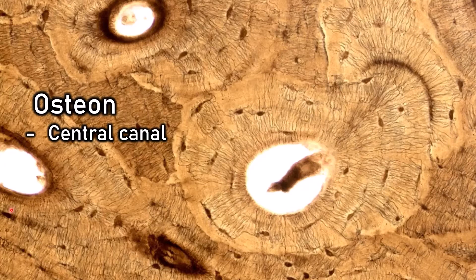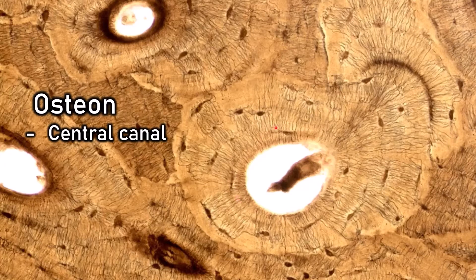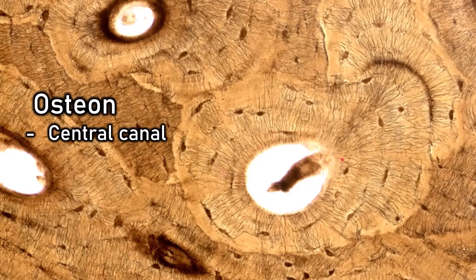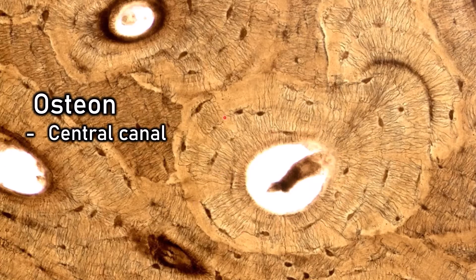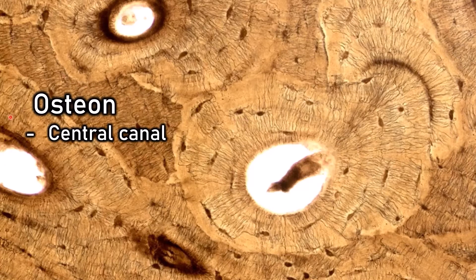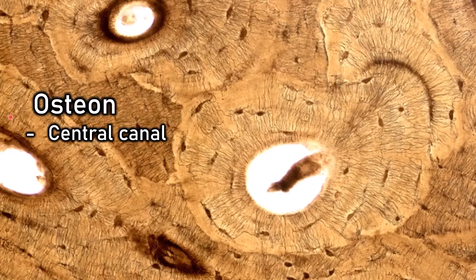If you look around the circular space, you'll see there are different layers, almost like rings on a tree. Those individual layers are called lamellae.